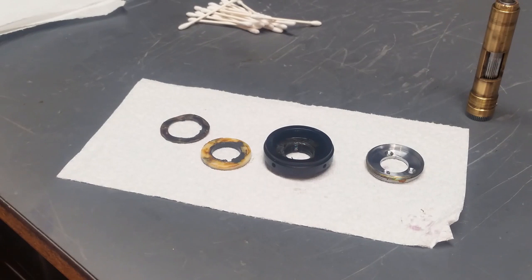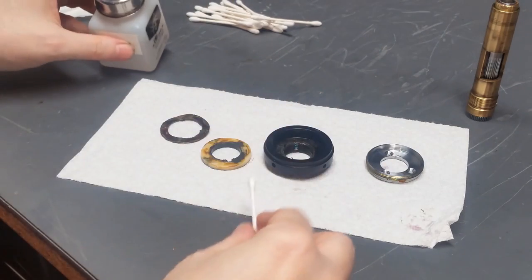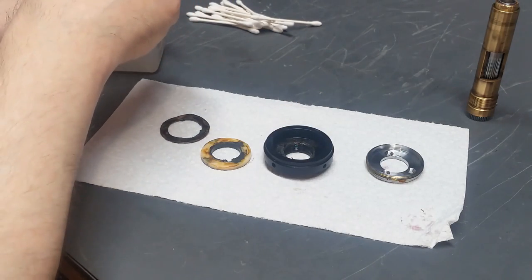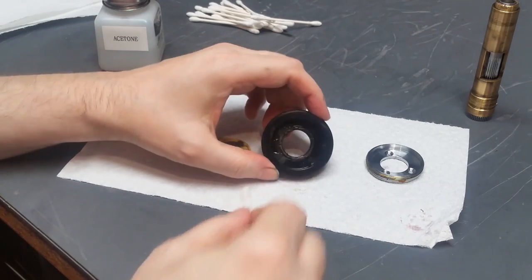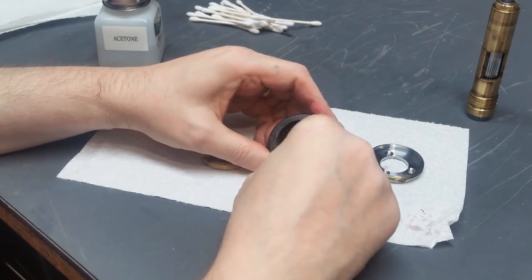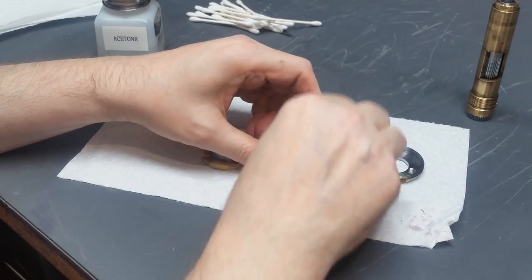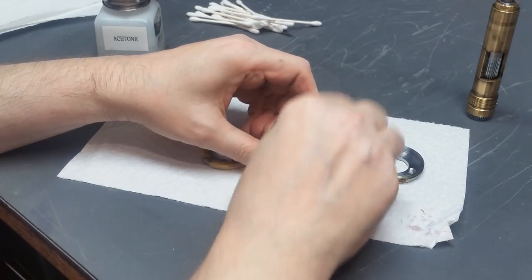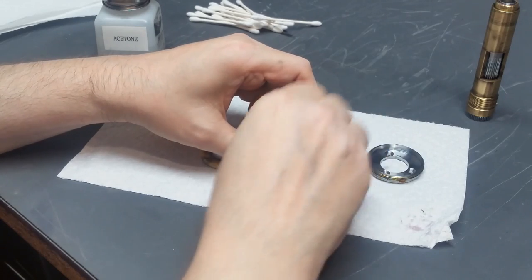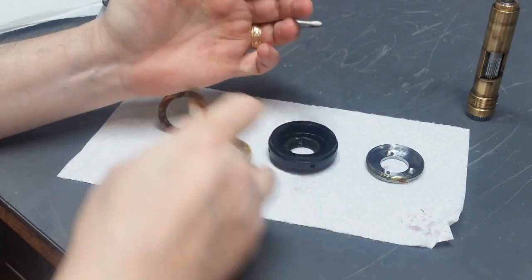Okay, I wanted to show you a little bit about the cleanup of these pieces here. You can see how filthy and disgusting they are. And the reason I'm showing you this is because this is why we're doing this rebuild. Look at what's in there. Look at what's coming out of there. This stuff is not acting like grease, it's acting like glue. And is it any wonder that the thing didn't work? It amazes me that it turned at all.